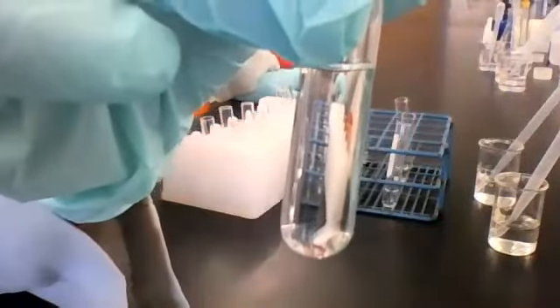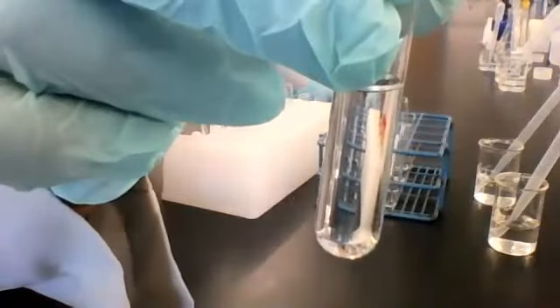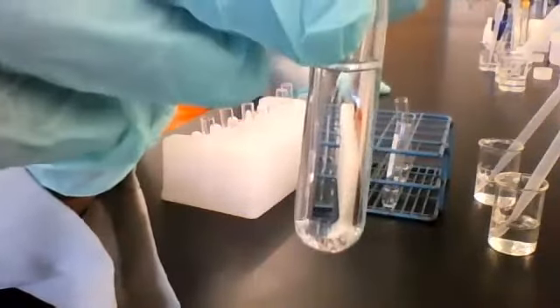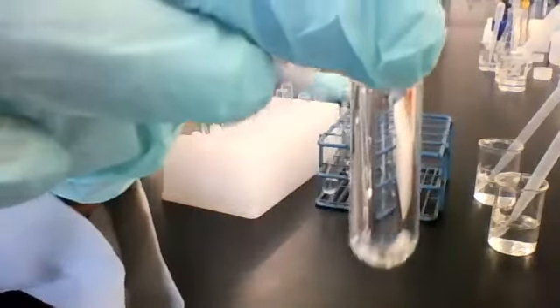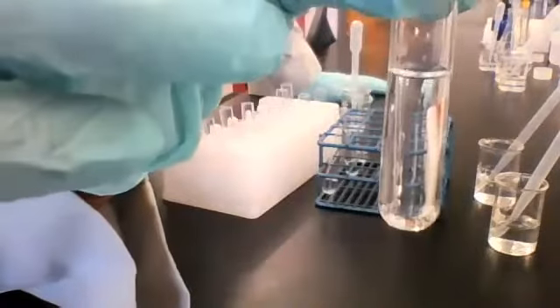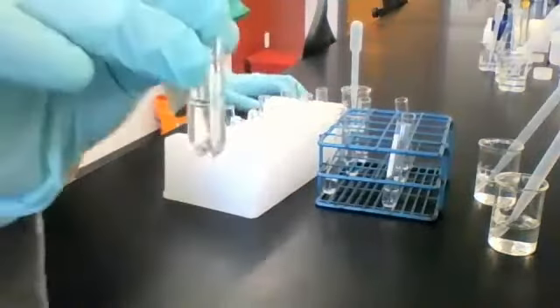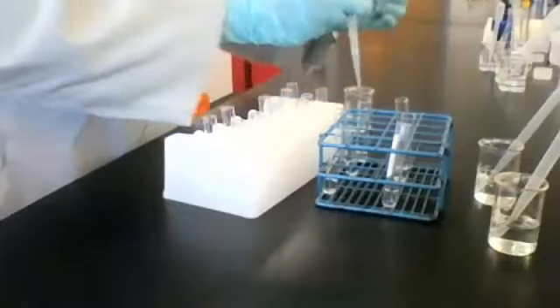Here's the resulting mixture. Write down the observation. Again, this is solution 3 combined with reagent B. Solution 3 is magnesium sulfate, MgSO4, just to help you keep track. All right. Here's solution 4, ammonium chloride. Let's see what happens when we add some reagent B.